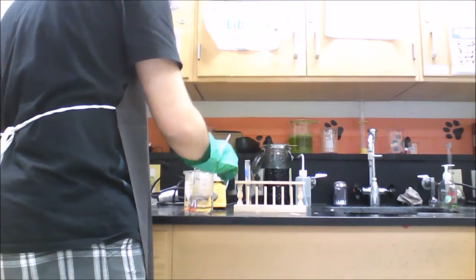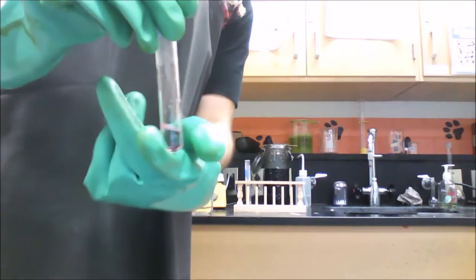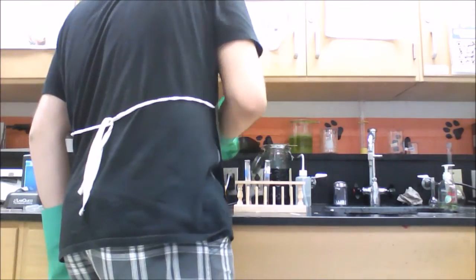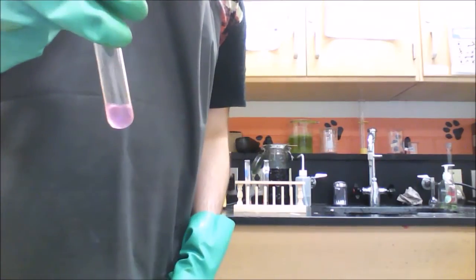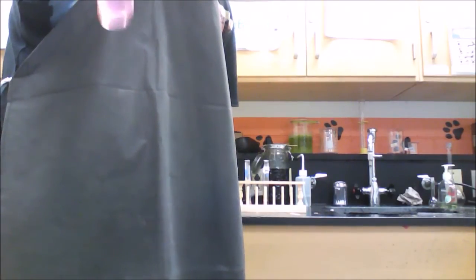Now for the hydrochloric acid, it actually got slightly darker, just a little. It's still a light pink, but a bit of it is darker. And the calcium chloride, it's more of a purple, so that must mean it increased in a little blue saturation to become more of a purple color rather than just pink.